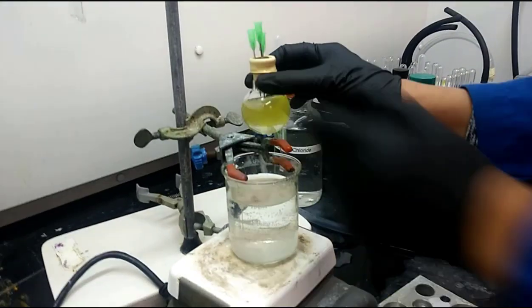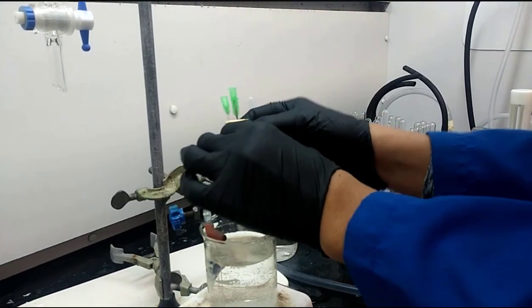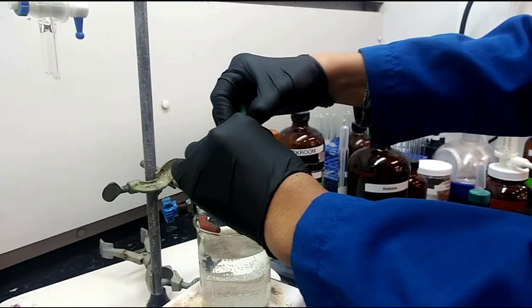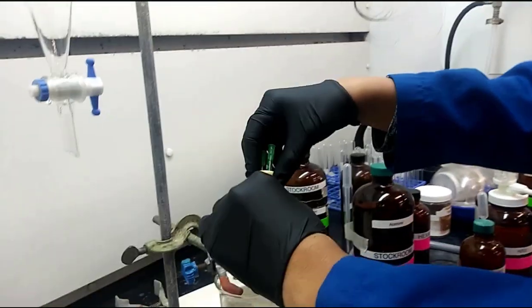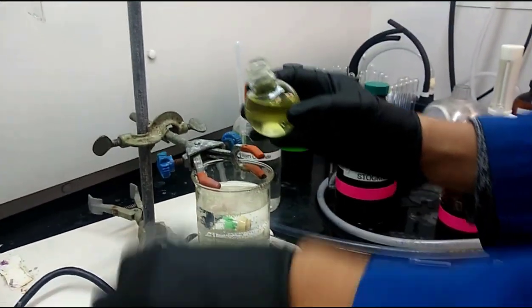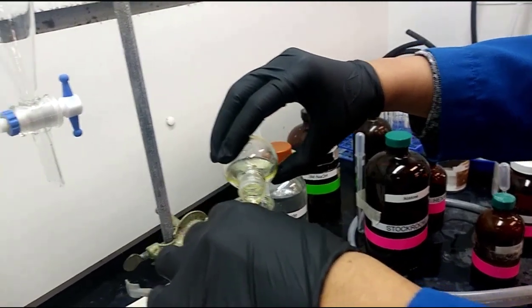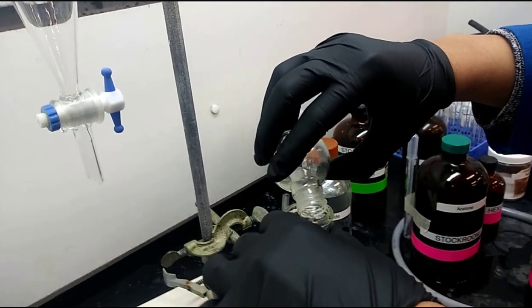Hello everyone, we are getting started with the second week lab experiment for creating an alcohol. Currently, you see the TA has a round bottom flask that has all of these needles in it. This is actually showing that at the point they're at right now in the video, they've already done steps 1, 2, and 3 for week 2, which is warm a beaker of water to about 35 degrees C.